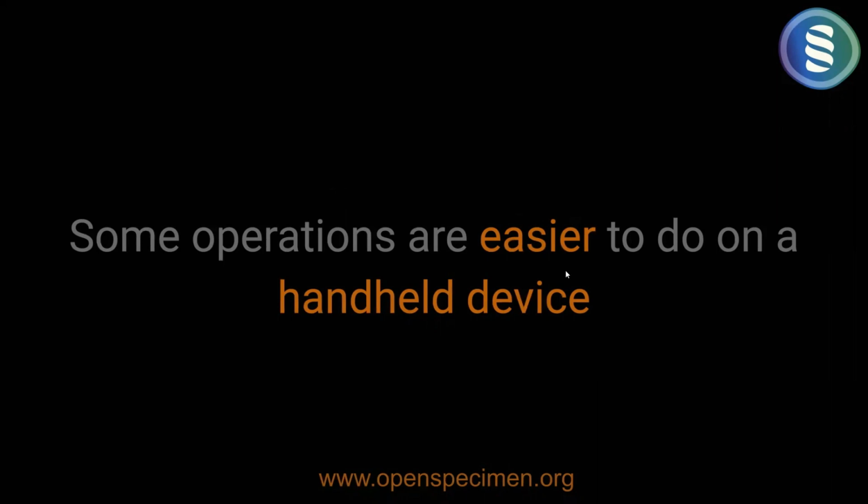For example, if you're configuring a new protocol, creating a new query or report, creating a new form, administrative tasks, reporting tasks, or building catalogs, those are not things you do in a mobile app. There are a lot of things in OpenSpecimen which are best done on a desktop or a laptop with a larger screen.